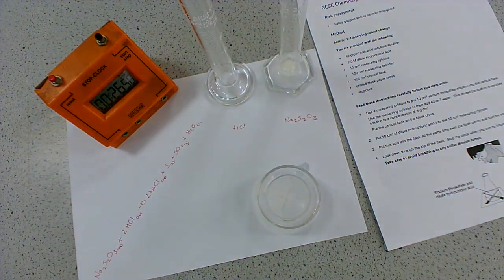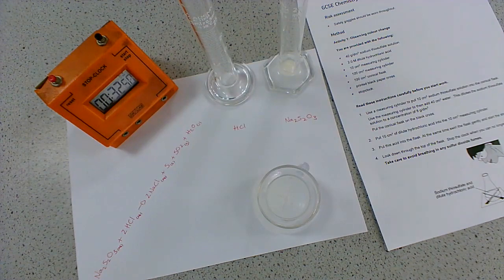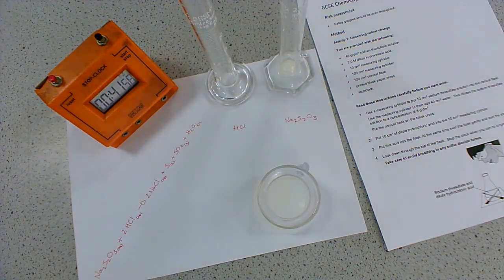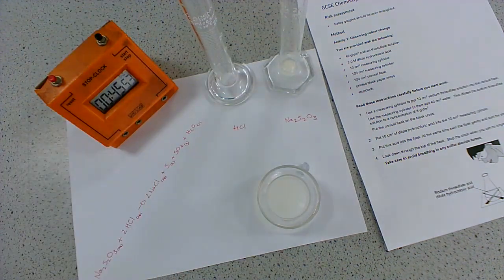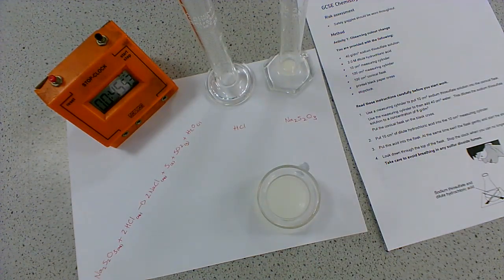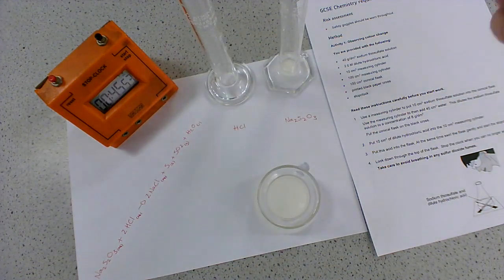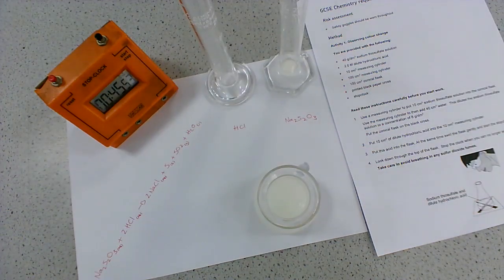In terms of the actual method, it is that simple. You add your thiosulfate, then you add your hydrochloric acid and start the timer at the exact moment you've added the second reactant. Looking at that, the cross has disappeared, so I would now stop the timer. It took 45 seconds. I would then rinse this out and repeat the entire method using a different concentration. In this activity, you're using different concentrations of the thiosulfate, but there's nothing stopping you differing the concentration of the hydrochloric acid.